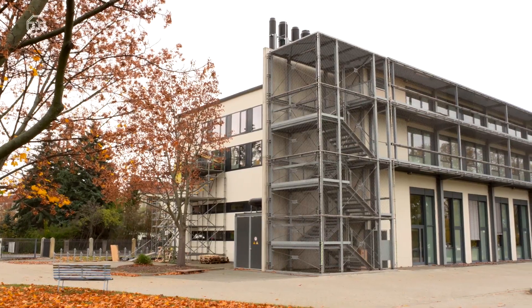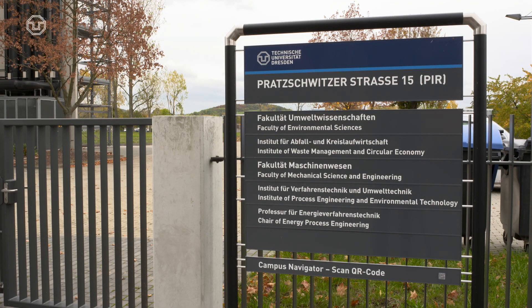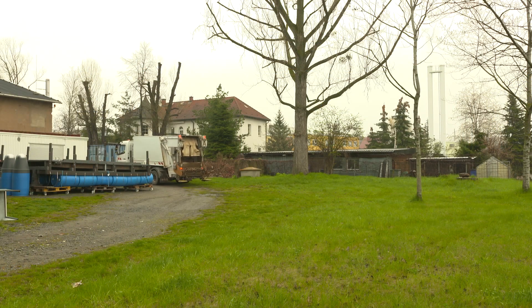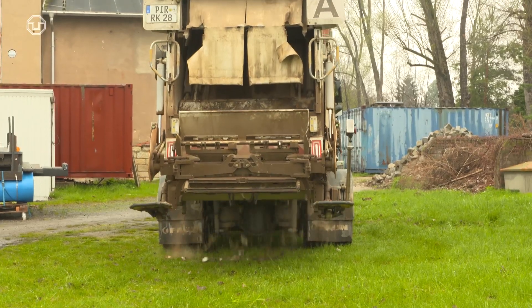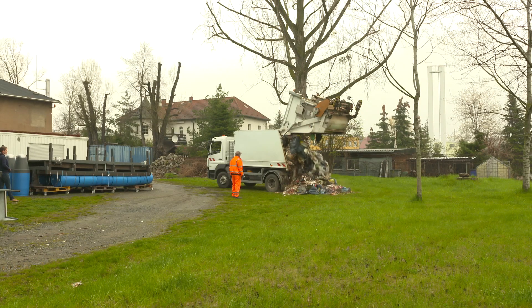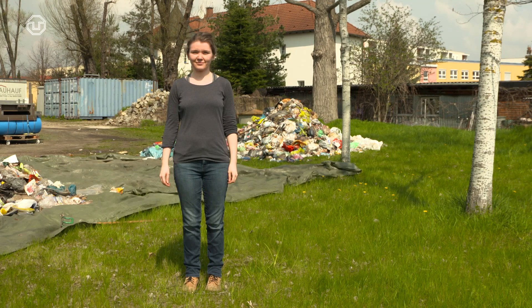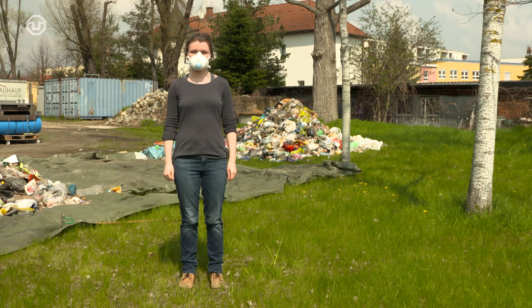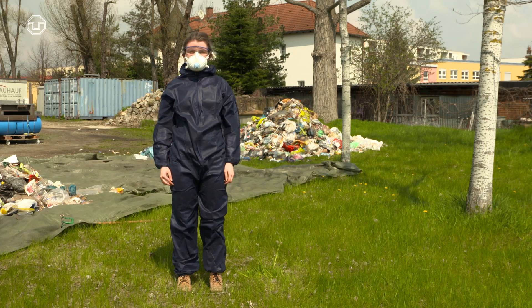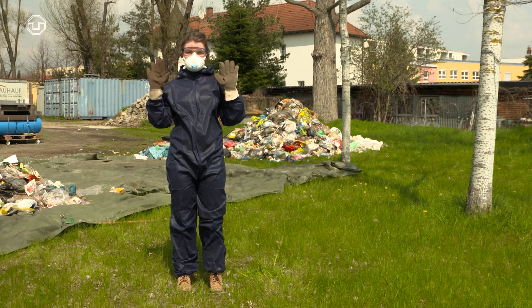Waste sorting is part of the education of the Institute for Waste Management and Circular Economy of the TU Dresden. For this task, a waste management company delivered two tonnes of residual waste. Laboratory work and experiments with waste require protective clothing and work skills. Before starting the sorting, make sure that you have sufficient knowledge and can ensure occupational safety.